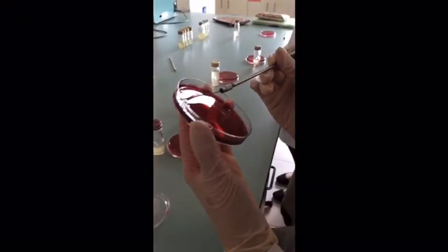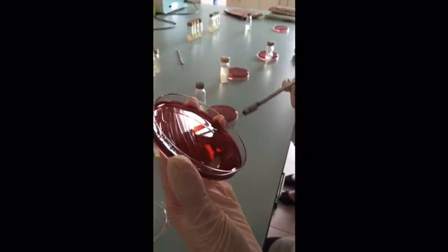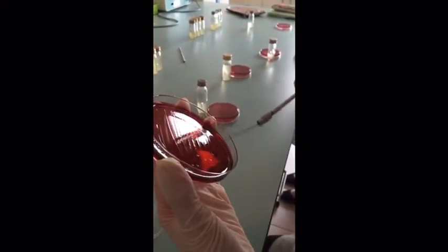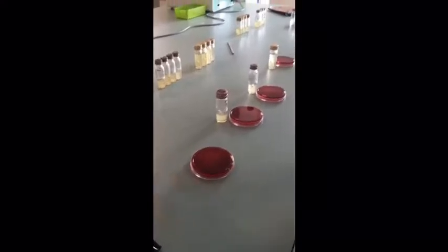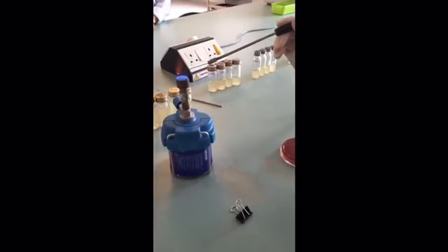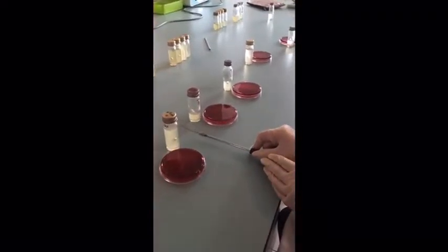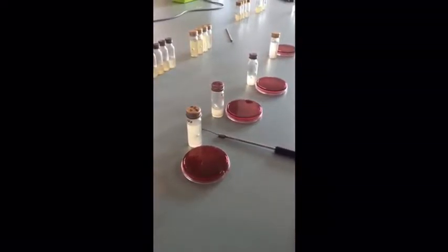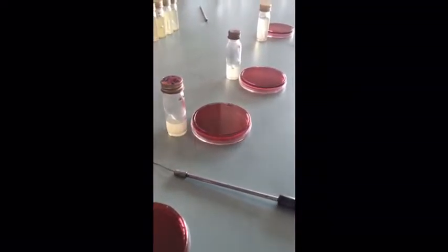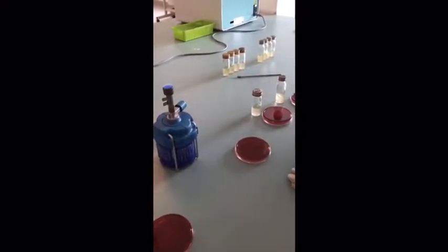For the first sample that we have done, we will be doing the streak plate for the sample from the FPSK pond. And the first sample is the double strength lactose fermentation broth. There is about 10 ml of the sample inside the broth. For the next 2 samples, that is 0.1 and also 1 ml, we will repeat the same steps for the same method.